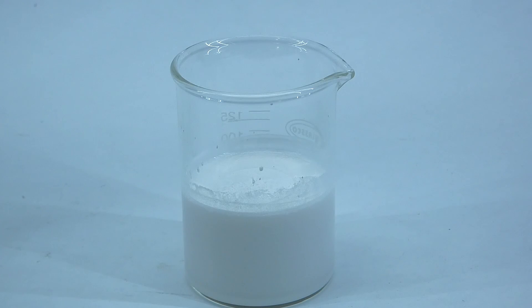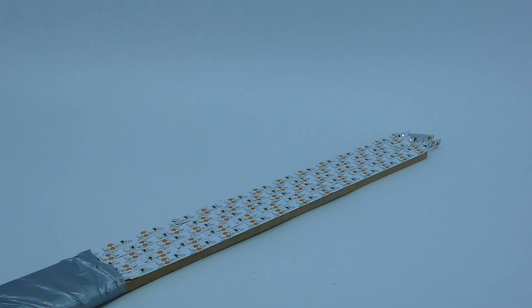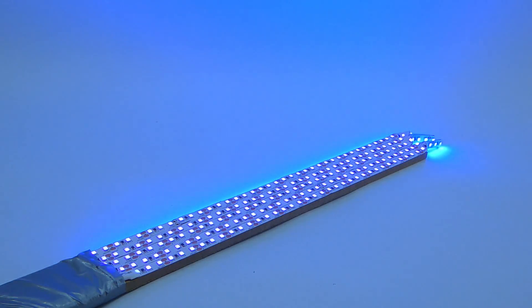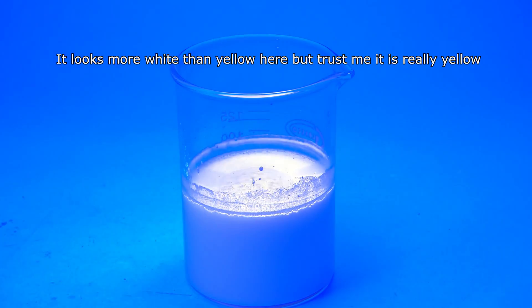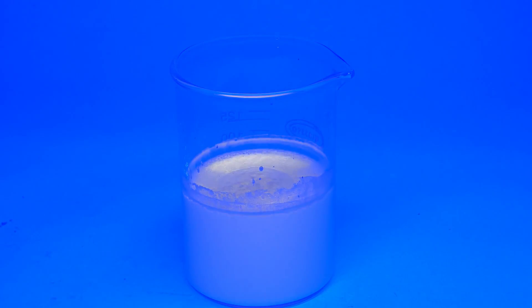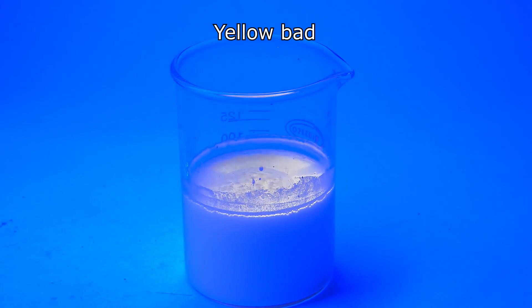To check its fluorescence, I turned off the lights, got myself my DIY UV lightsaber, and when I turned it on, the solution started to give off a very nice yellow glow, and I think that this is the first, and hopefully the last time, when I said nice yellow in my life.